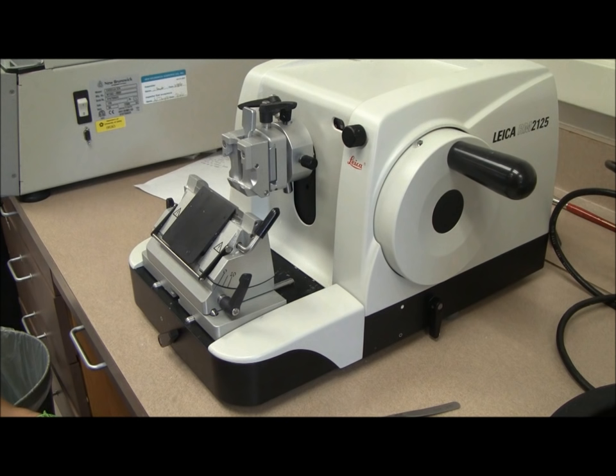The microtome is an instrument used to cut sections from tissue embedded in paraffin wax so that they can be stained and imaged.